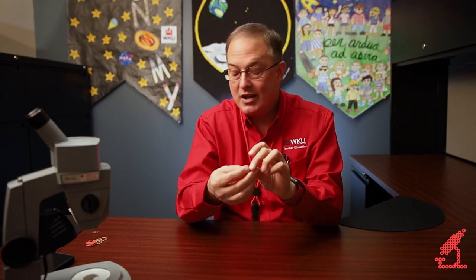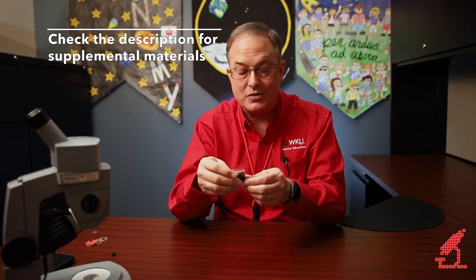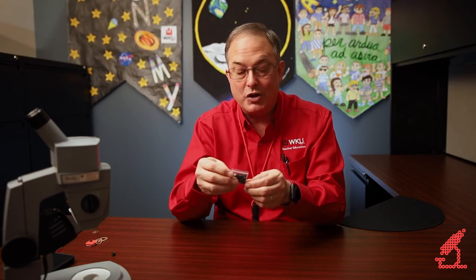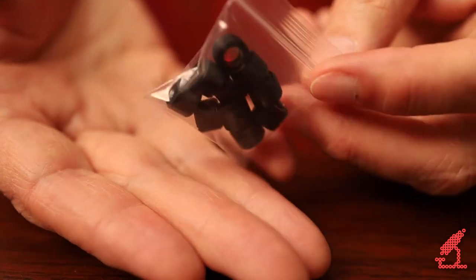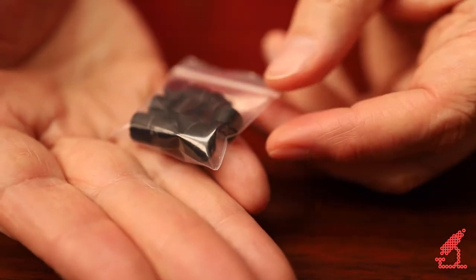You can buy one and literally smash it open and pop the lens out. These particular lenses — I have a source for these, and in our supplementary materials you can get that source — where you can buy a pack of 10 of these for $10. So this microscope is going to cost you and your students a little over a dollar to make.